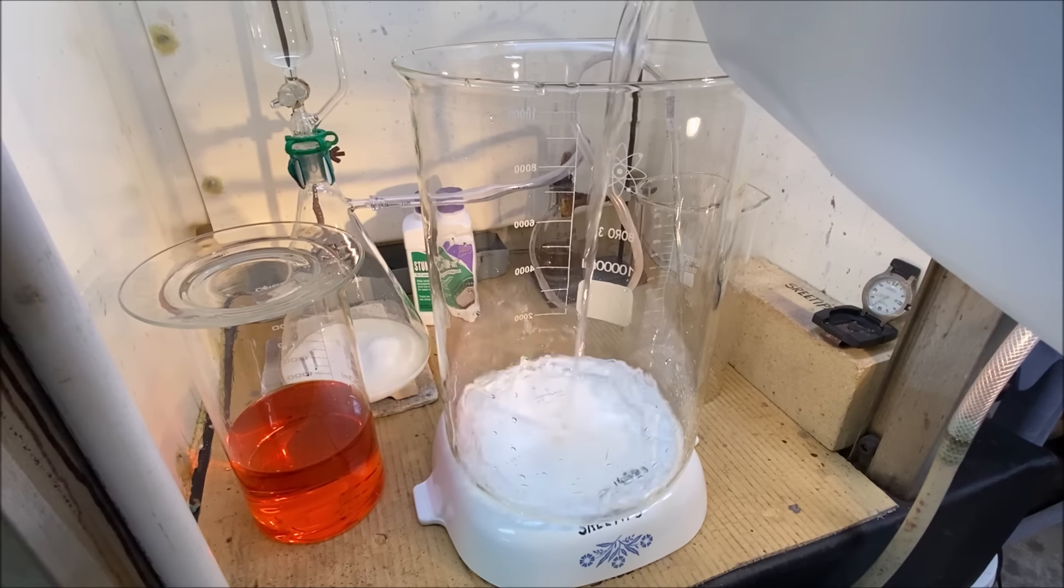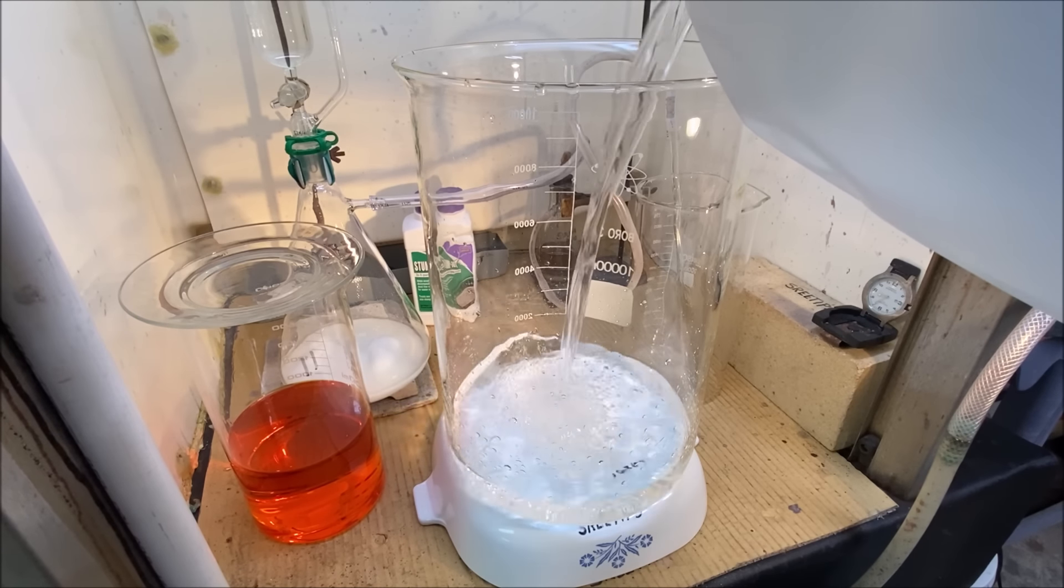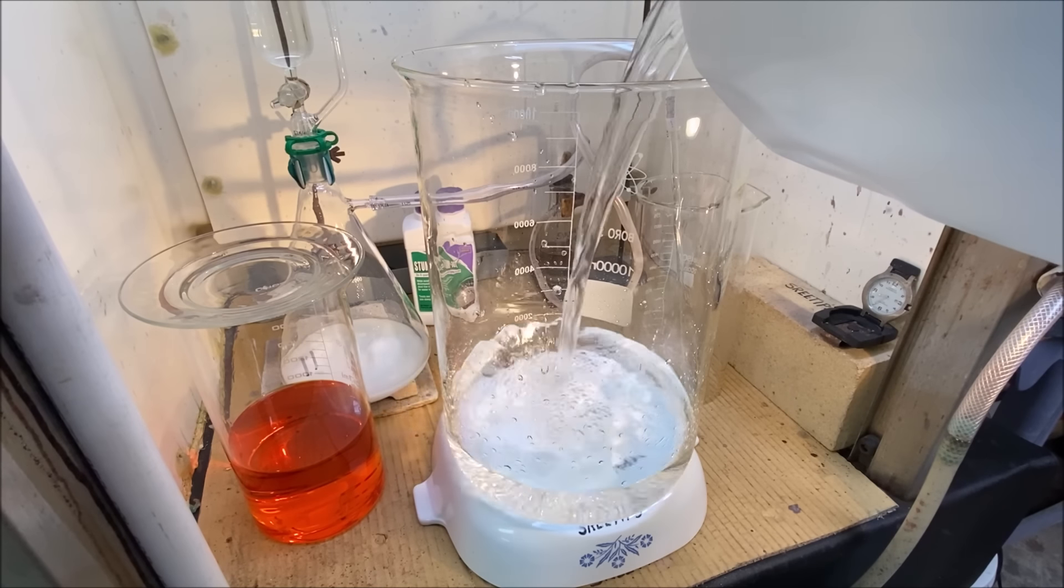Okay, you've heard me say it before that this solution or this reaction happens better when the solution is diluted, so I'm going to add about six liters of distilled water here.